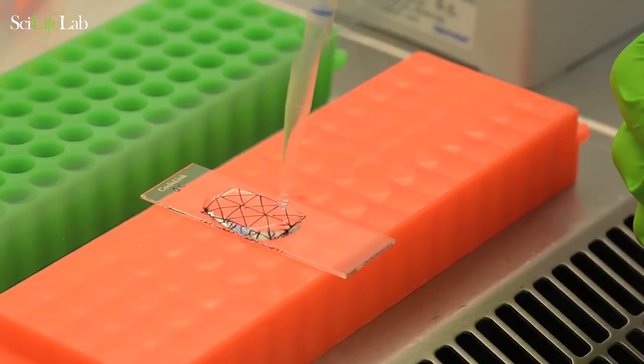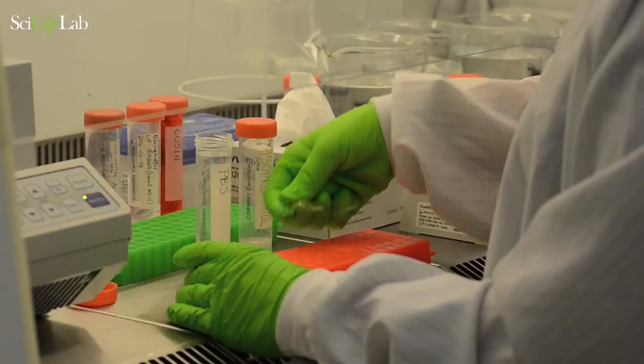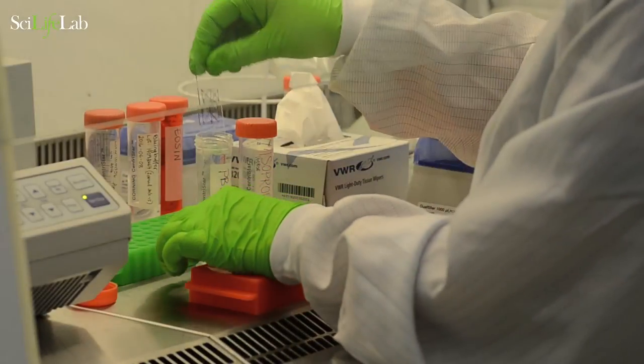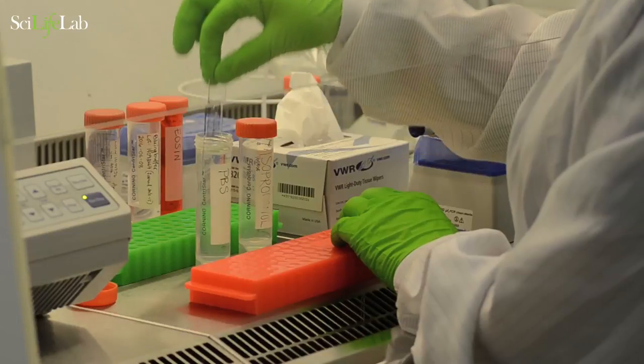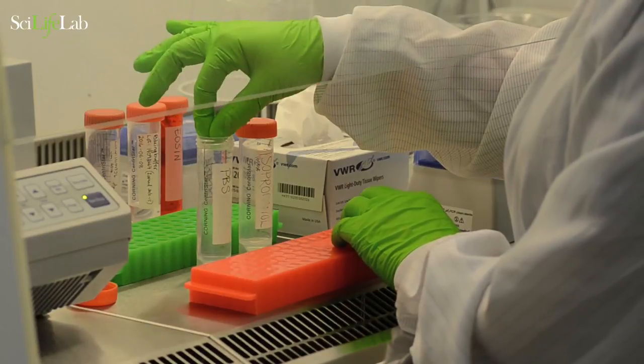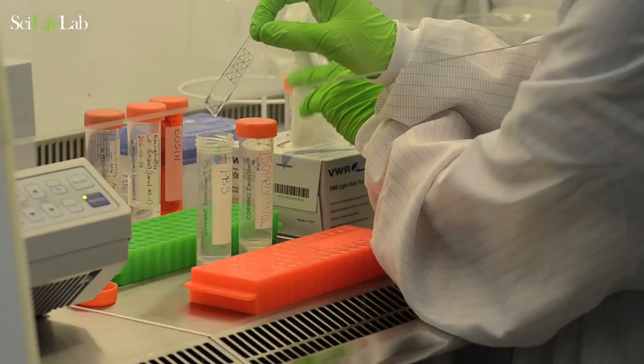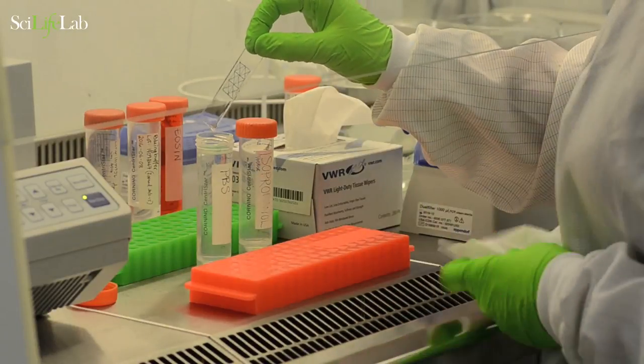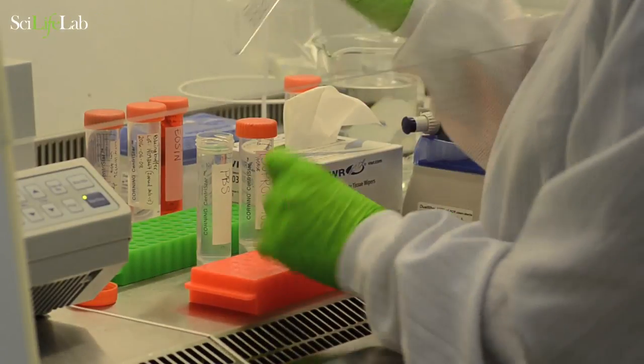Incubate for 10 minutes at room temperature. Wash away the formaldehyde by dipping the glass slide into a PBS solution. Carefully dry the edges and back of the glass slide and lie flat.